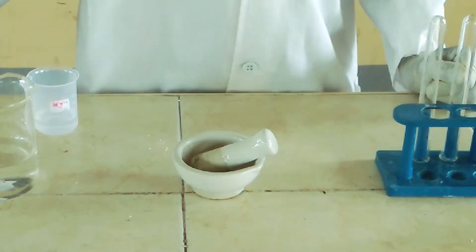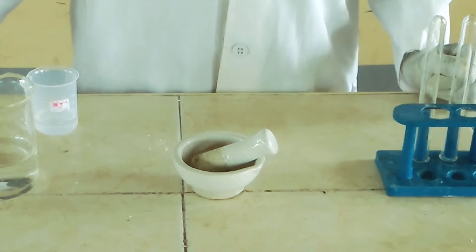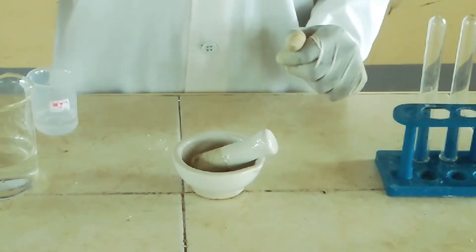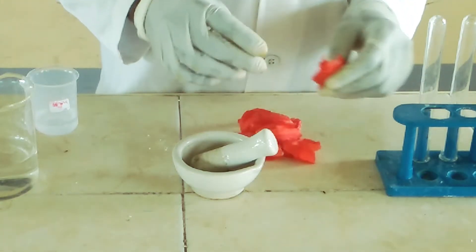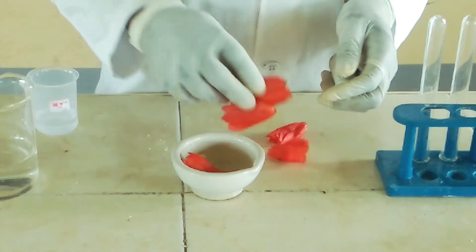I'd like us to prepare a simple acid-base indicator using simple materials. I'm going to use flower extract to prepare a simple acid-base indicator.